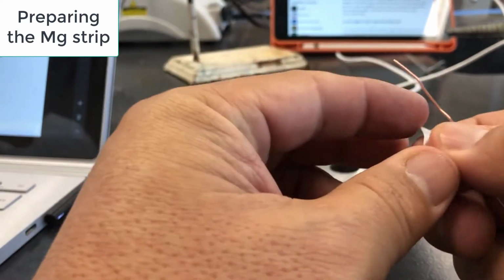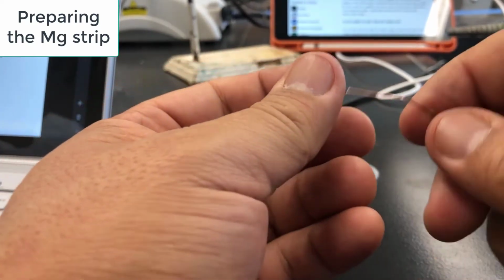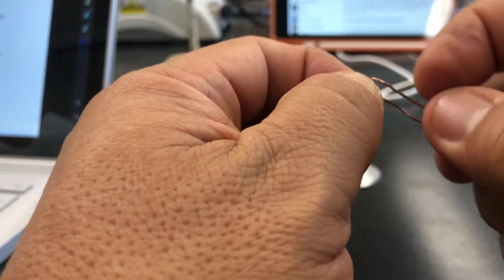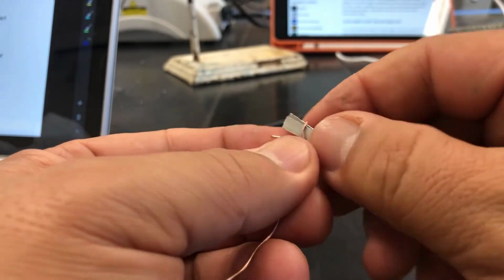Okay, so in this experiment, this piece of magnesium is going to react with hydrochloric acid in the end of the eudiometer, and it has this tendency to float away. So what we're going to do is create a cage for it to kind of hold it in place. To do that is pretty simple. You pinch it in place. So I'm going to do this, all right, and then I'm going to wrap the wire around it like this. And it doesn't have to be precise. The idea is that you surround the piece of magnesium with copper so it doesn't float away.